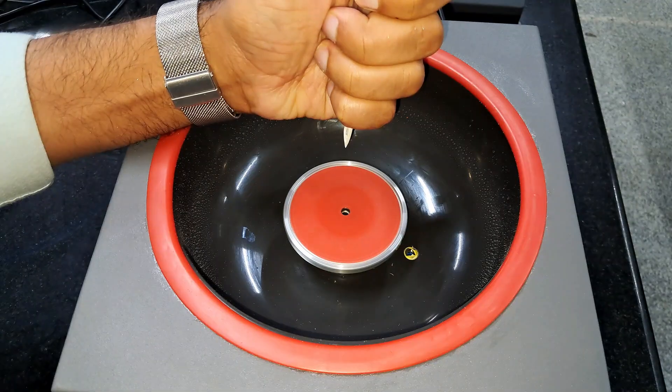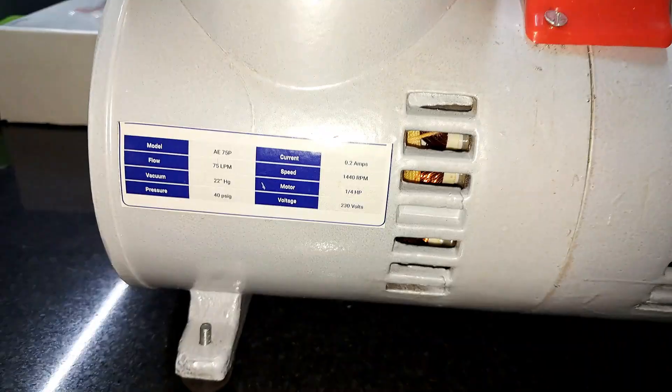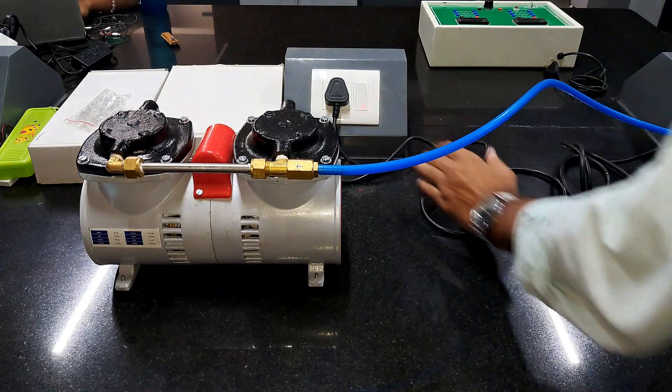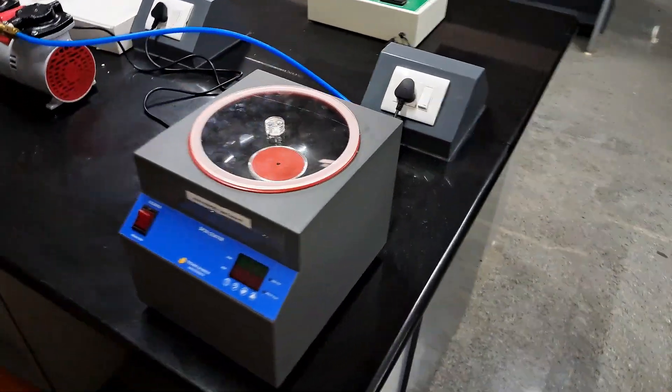In this video I will guide you step by step on how to operate the spin coater machine safely and effectively. We have got these two things in our setup: vacuum pump and the spin coater.